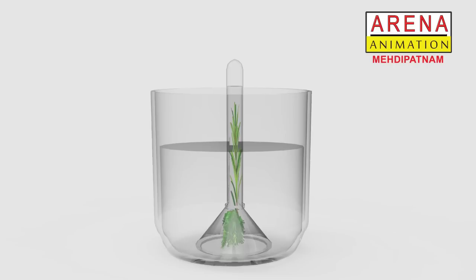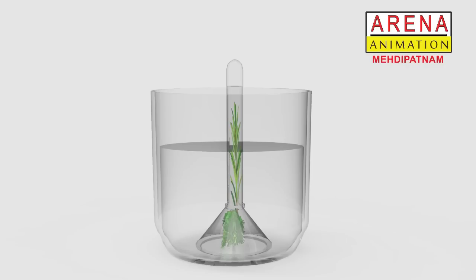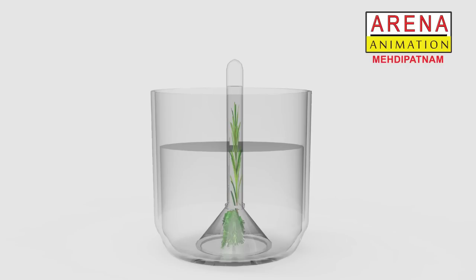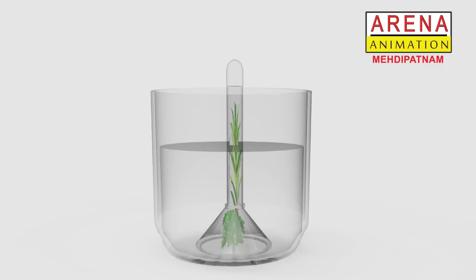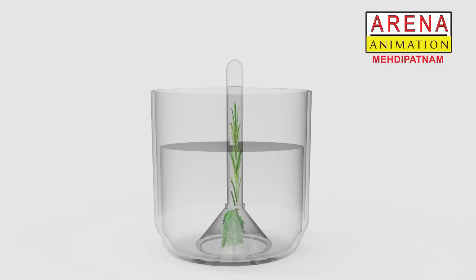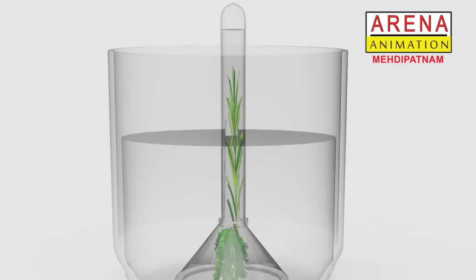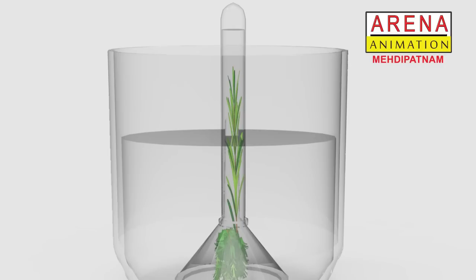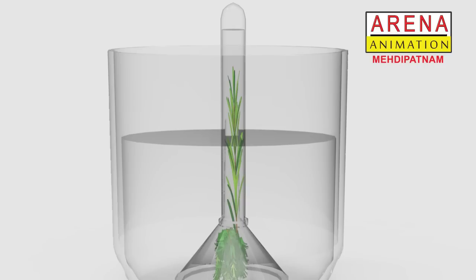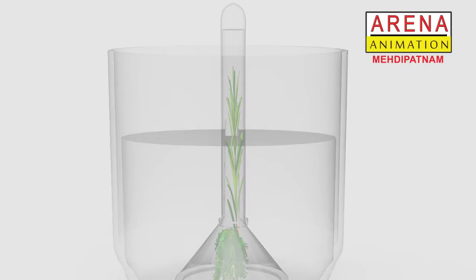After two hours, we can see the formation of gas in place of water at the topmost point of the inverted test tube of setup A placed in sunlight. We can also see gas formation in setup B kept in the dark place, but the quantity of gas formed is less compared to the gas formed in setup A.